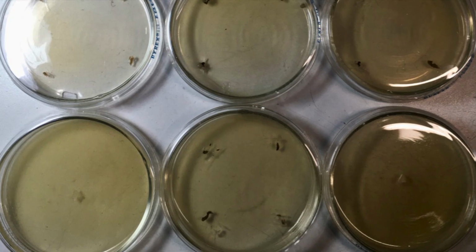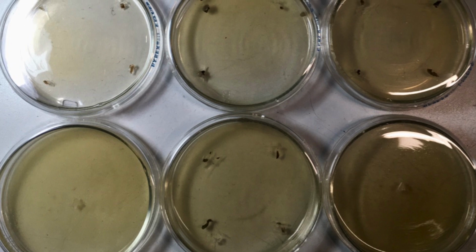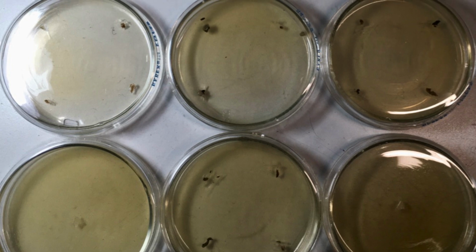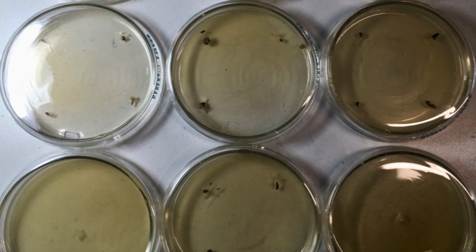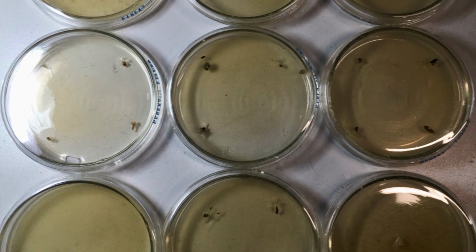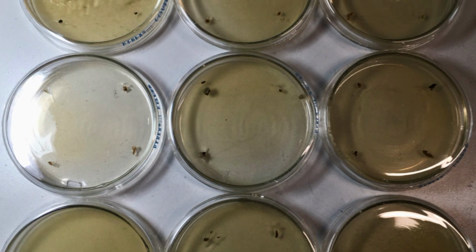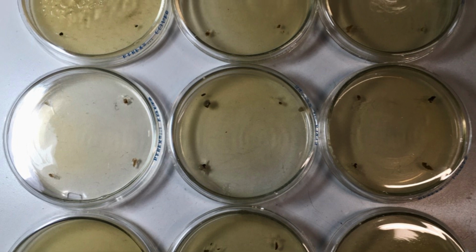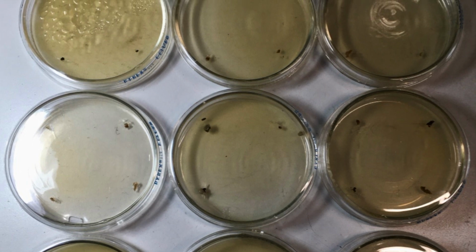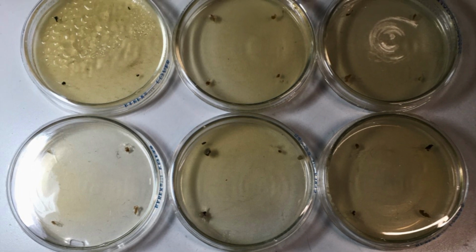I've got glass petri dishes. They're new to me as of October of 23, and the glass petries were used when I got them at a school. They had unknown residuals on the glass from the previous user, but that seemed unlikely. But it was a biology class or agribusiness class of some sort. So they could have used chemicals with fungicide maybe. The petries had been cleaned up and dishwashed and have made successful grows. So that seemed unlikely, but was a possibility. And maybe I finally used a subset that had had a persistent residual of some sort.